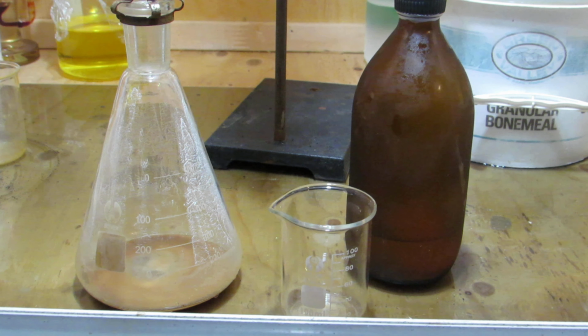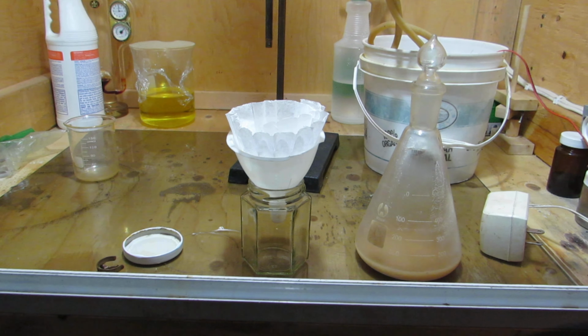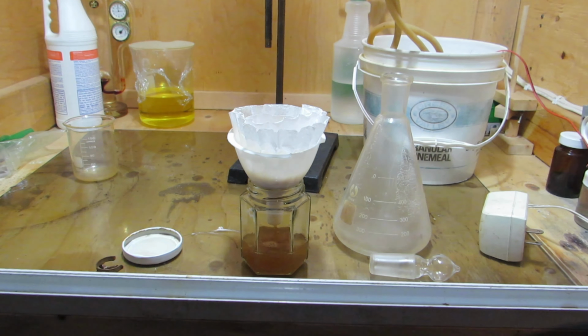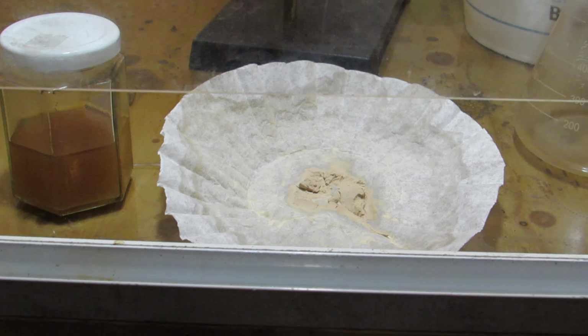Theobromine is insoluble in diethyl ether, however any other organic compounds extracted from the cocoa will dissolve into the ether. It is important that the flask is cold, as diethyl ether has a low boiling point. After adding 60 milliliters of ether to the flask, a suspension of theobromine remains. It was chilled in the fridge and then filtered and rinsed with ether to isolate the theobromine. As can be seen, the impurities remain dissolved in the ether. The diethyl ether was distilled to recover it, and the theobromine was left to dry in the fume hood.